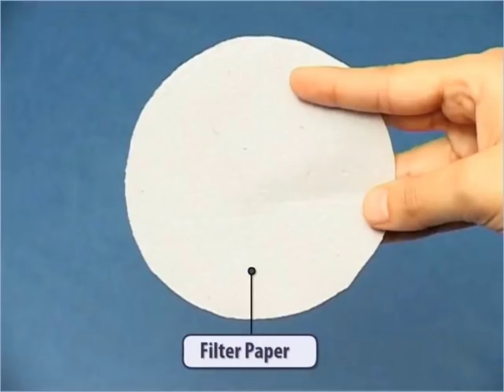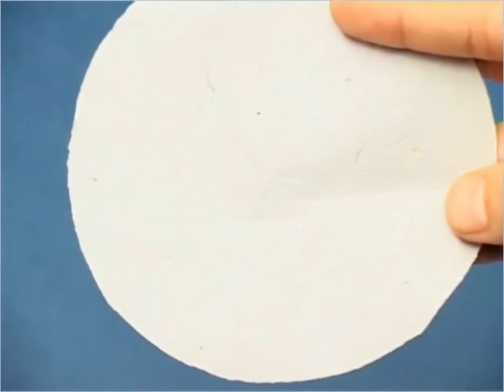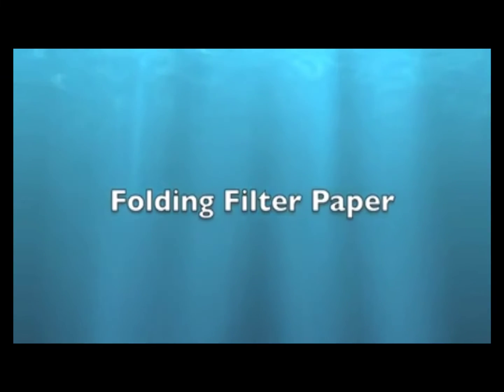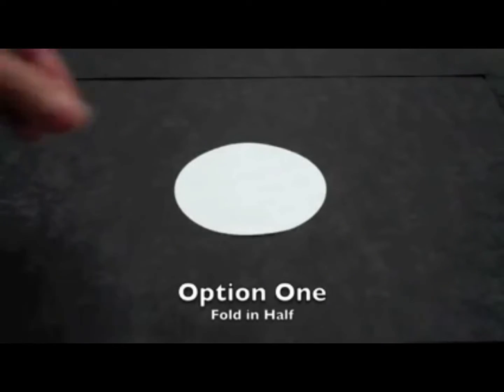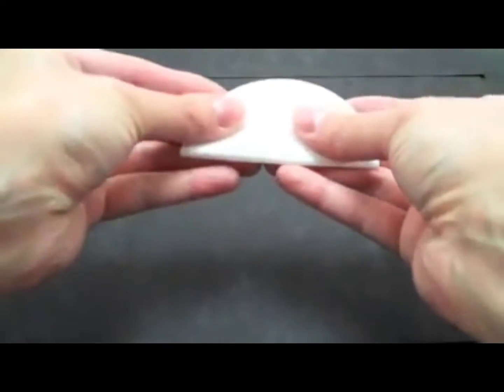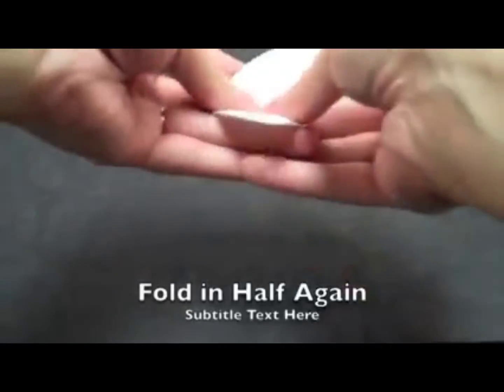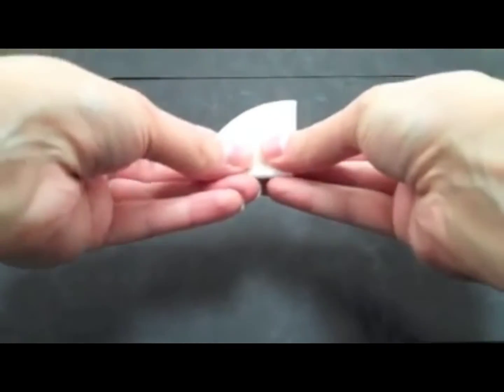A filter paper can separate the fine particles of mud from the water, as it has smaller pores than cloth. Folding filter paper. First, fold in half, just like how I illustrate. Next, fold in half again.